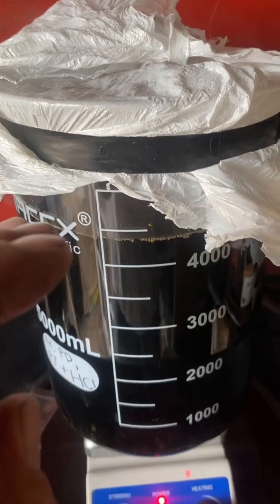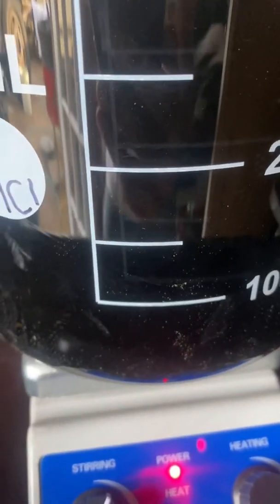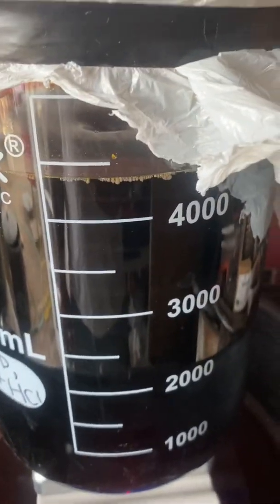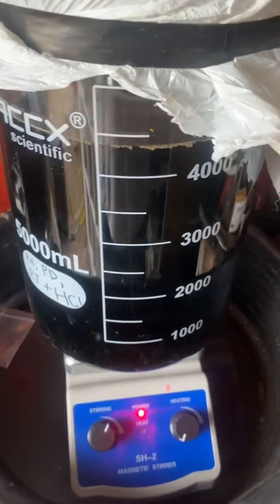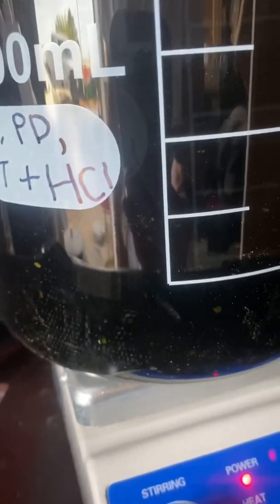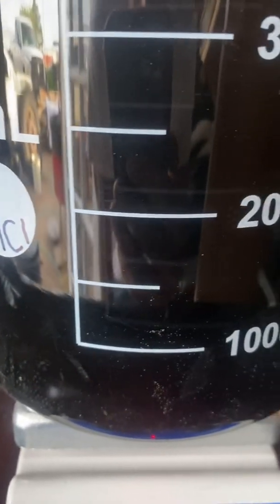Hopefully it will only drop out our precious metals, and we'll be left with some copper and precious metal dust at the bottom. Leave this here for a few days. See, it's stirring pretty good — we got a cyclone in the center there, a little funnel. Once we get this done, hopefully all of our precious metals are gonna fall out of solution. See, it's starting to chunk up and mix around with the copper right now — see those particles floating around. That's our platinum metals: rhodium, palladium, and platinum binding to that copper, is what I'm hoping, and falling out of solution.